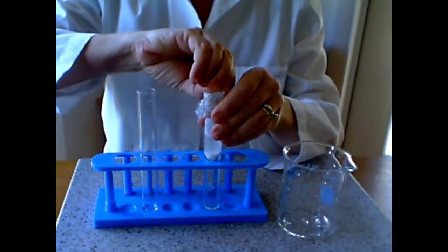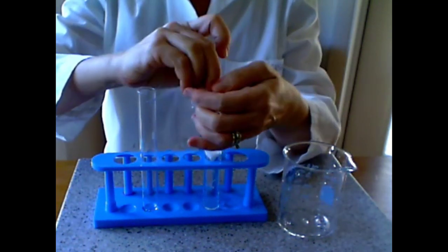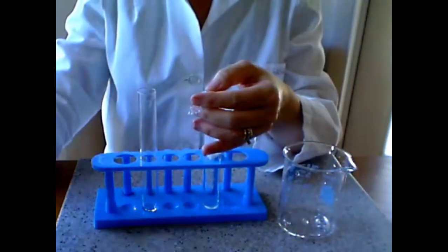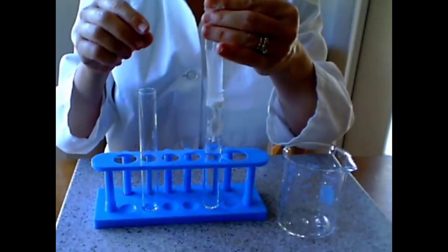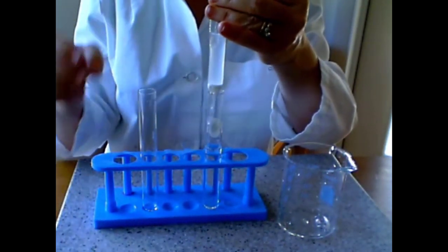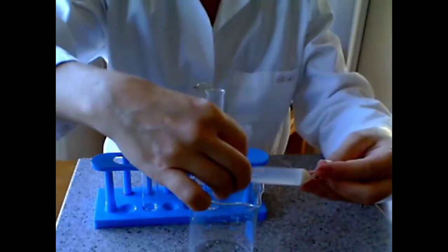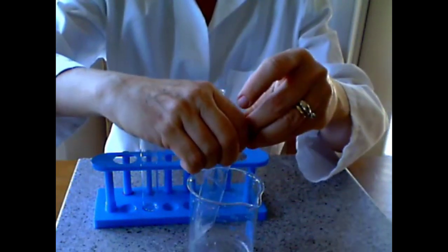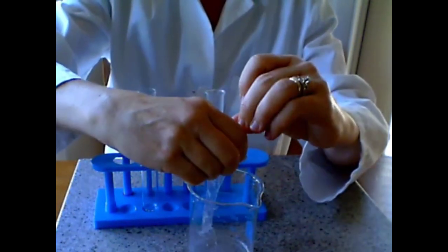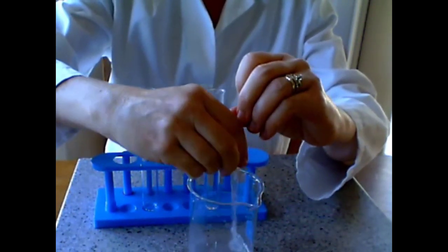It's been 30 minutes now. We are going to remove the rubber band and remove the dialysis tubing from the test tube. We are going to empty the contents of the dialysis tubing in this clean beaker. We are going to save that for later.